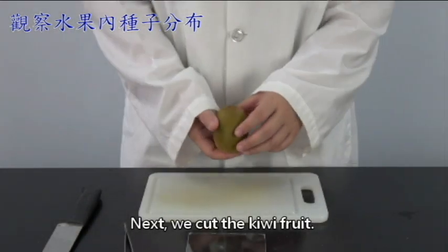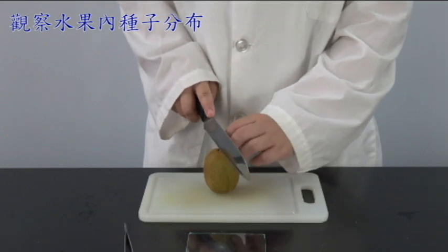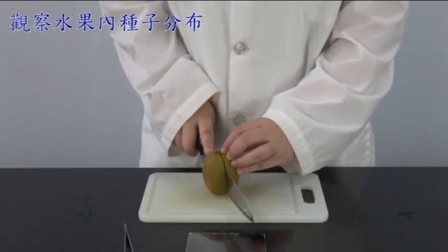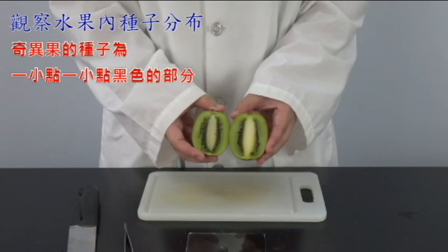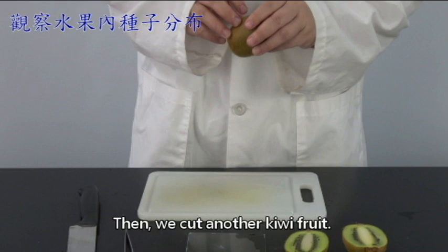Next, we cut the kiwi fruit. Cut it from the top downward. Let us take a look at the distribution of seeds. Then we cut another kiwi fruit.